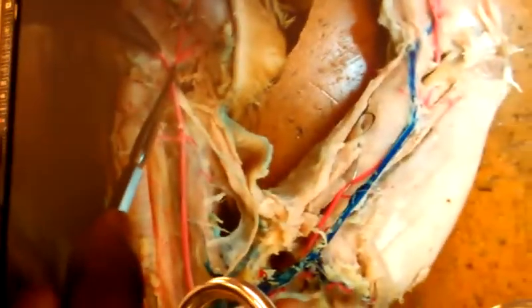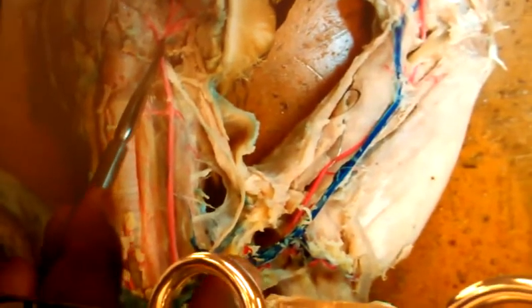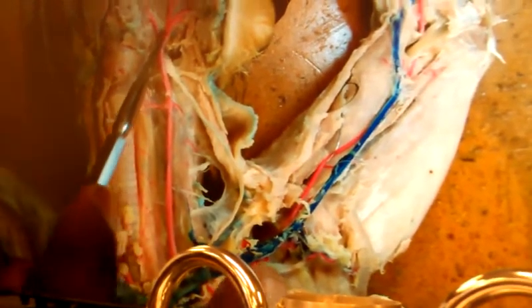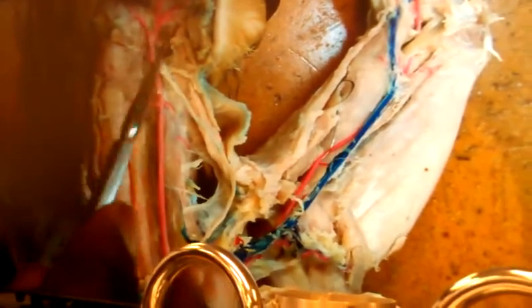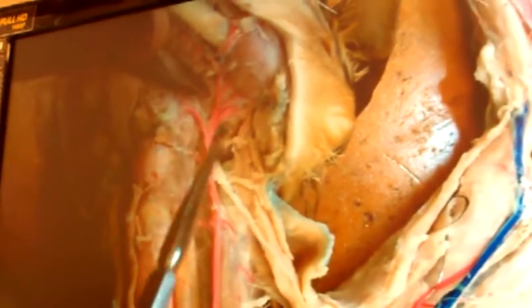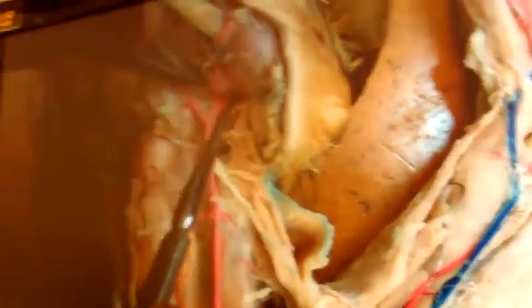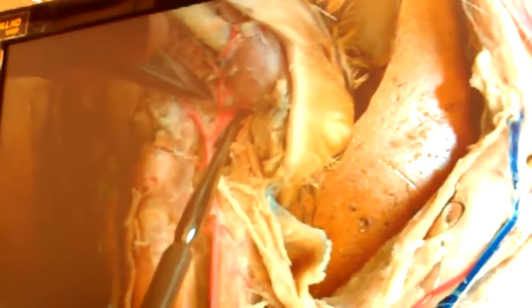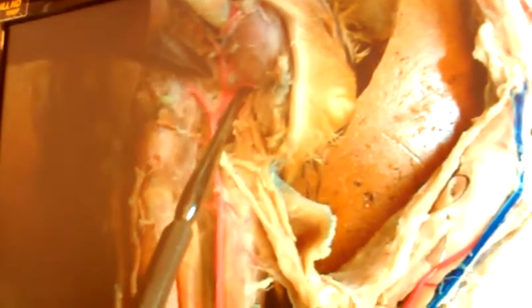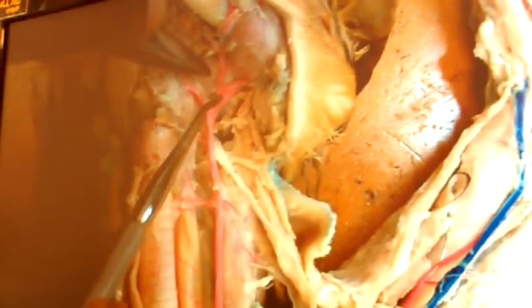External carotid. I'm no longer, Mr. Gilmore, left common carotid. I am now, at this point, external carotid. But Mr. Gilmore, there's something unique about the external carotid. You'll notice he's going to throw the peace sign too. What do you mean throw the peace sign? He's going to split. He splits here and here. One, like Lil Wayne say, I'm going in. Look, he's going in, so what are we going to call him? Internal maxillary. We got one going out, so we're going to call him external maxillary.